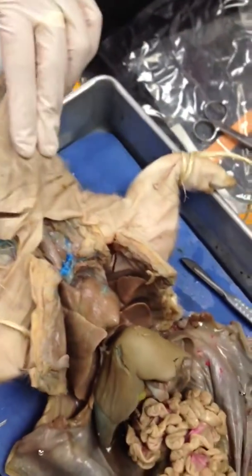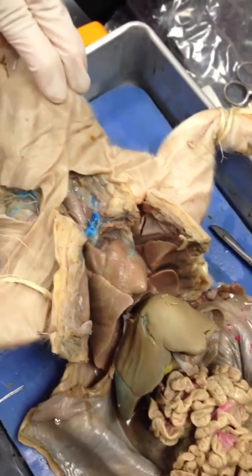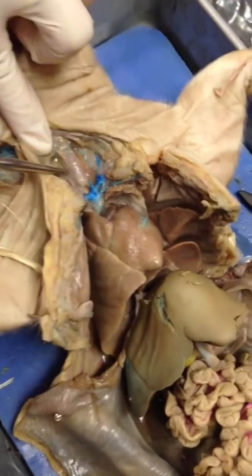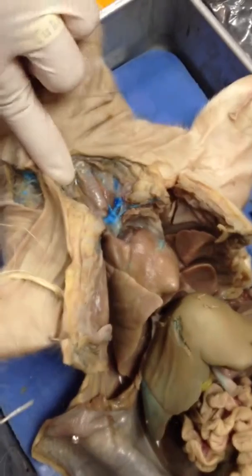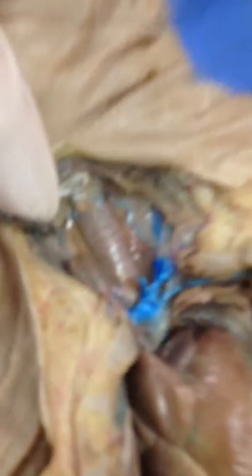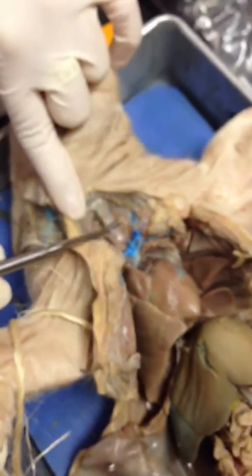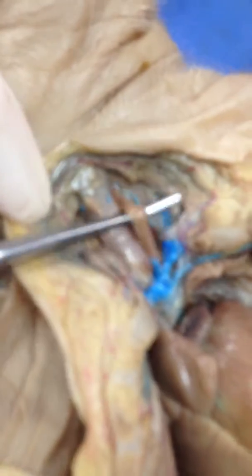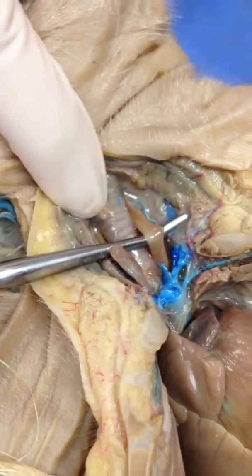Right, and remember last time we saw the trachea on the sheet, and it had the hyaline cartilage surrounding. So the trachea is right here. We can use this as a marker to help us find the esophagus. So the esophagus will be posterior and lateral to the trachea. So we want to dig a little bit. And right here is the esophagus. Okay, so that rubber band-like structure is the esophagus.